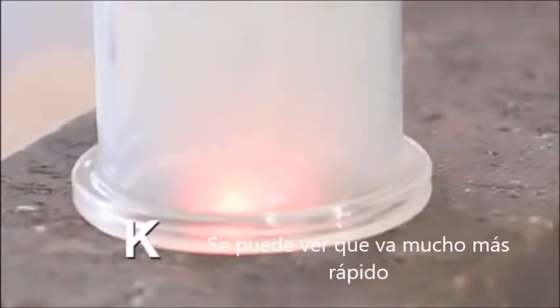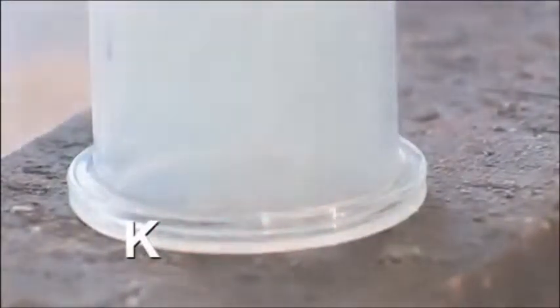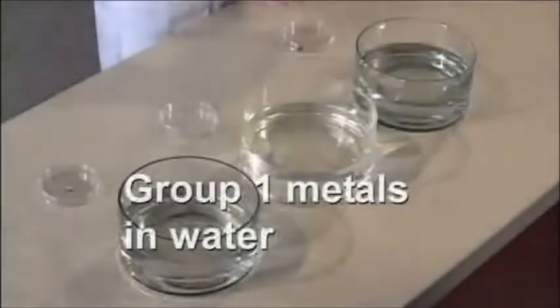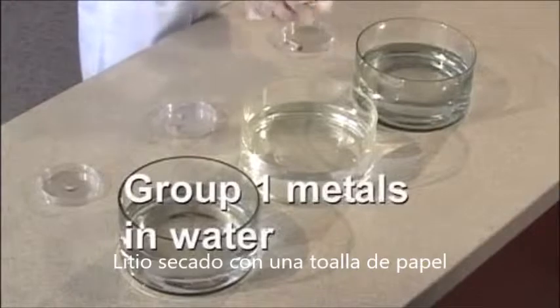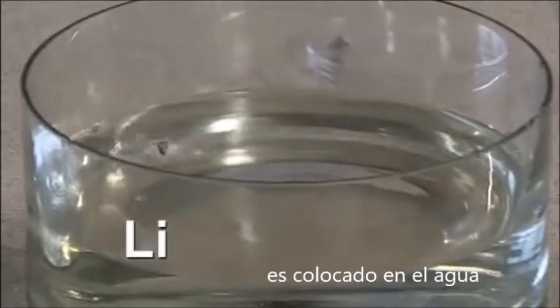See, that one goes much quicker. Lithium, dry it off with a paper towel. Put it in the water.